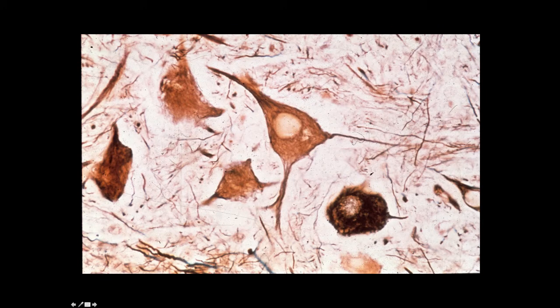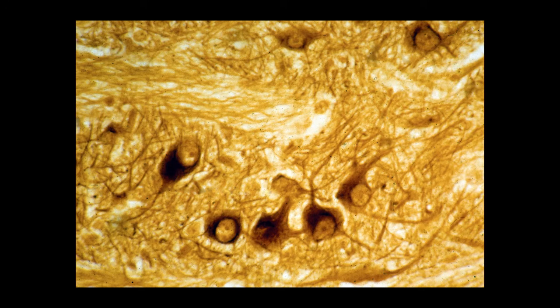Here are some more multipolar neurons that are stained with the silver stain. Neurons preferentially take up heavy metal, and you can notice a lot of neurofibrils on this slide. These are essentially aggregates of neurofilaments and microtubules, and these filaments run throughout the cytoplasm in neurons. Here are some more multipolar neurons that are silver stained, and again, these are in the anterior horn of the spinal cord. You wouldn't be expected to know that at this point in time, but you can see this network of neuropil or cytoplasmic processes from these various neurons.